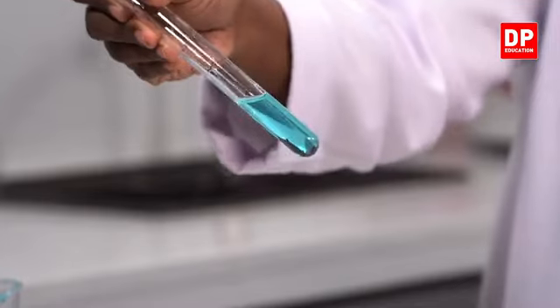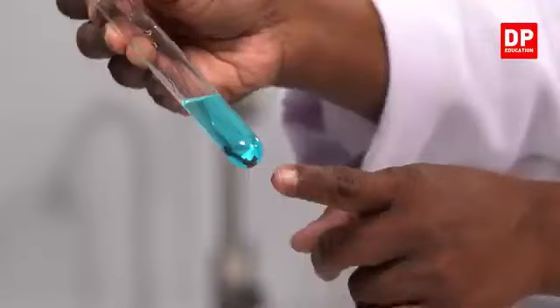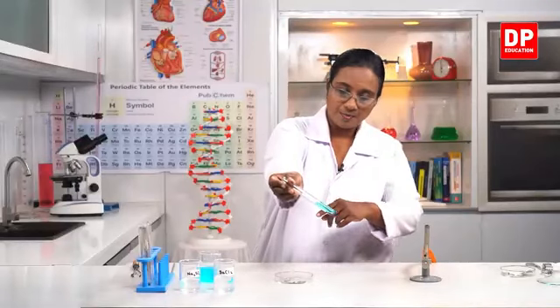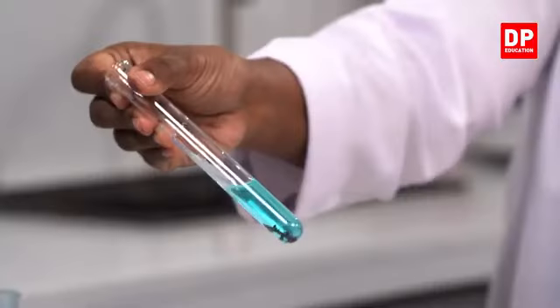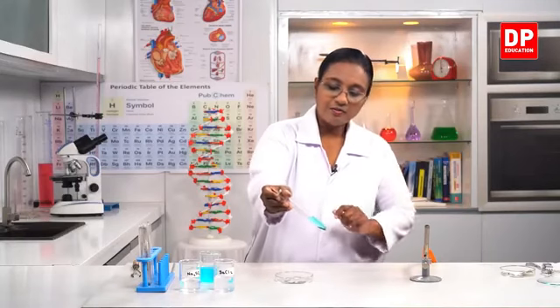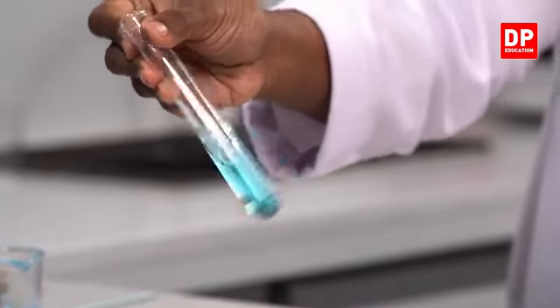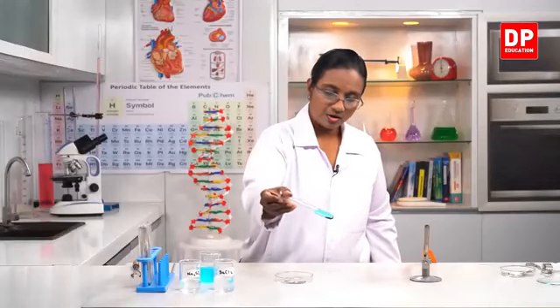When I shake it, you all can see it moving, and also from here, can you see at this part a reddish brown color solid substance? You all can see that is copper. So you can see the reaction is taking place. Zinc is reacting with copper sulfate. You can see the color of copper sulfate has decreased a little bit, and also copper depositing at the bottom. If we leave it for some more time, the reaction will occur further.